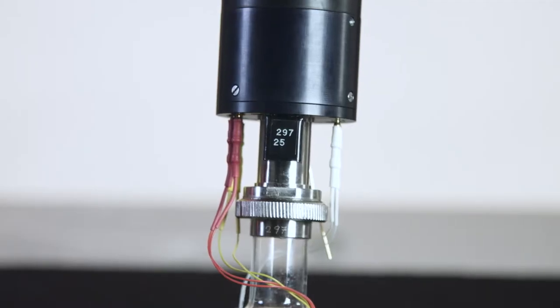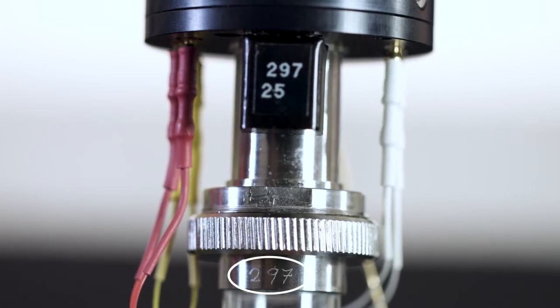Make sure the correct temperature plug is mounted in the SolCal and the identification number is matching the SolCal vessel number.